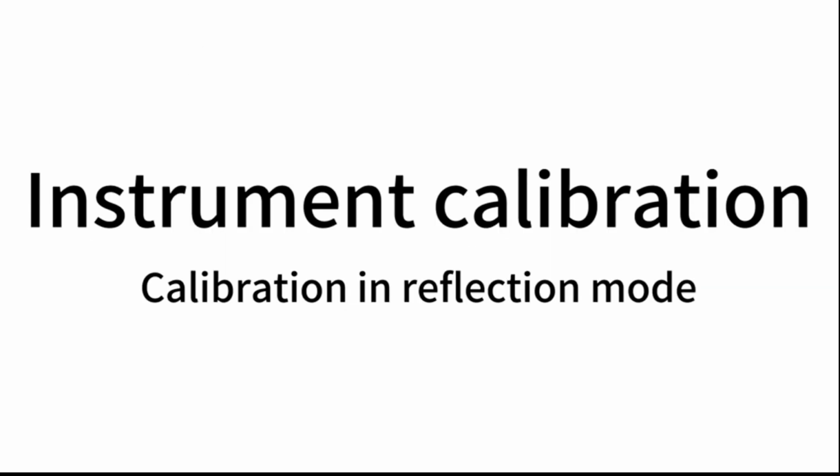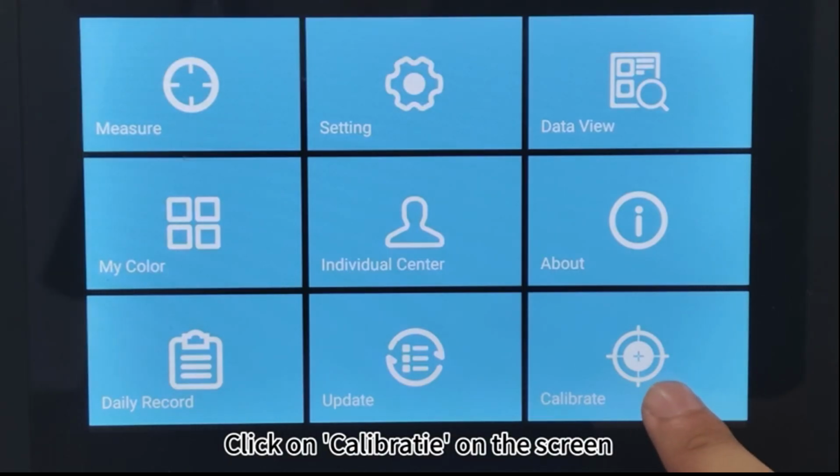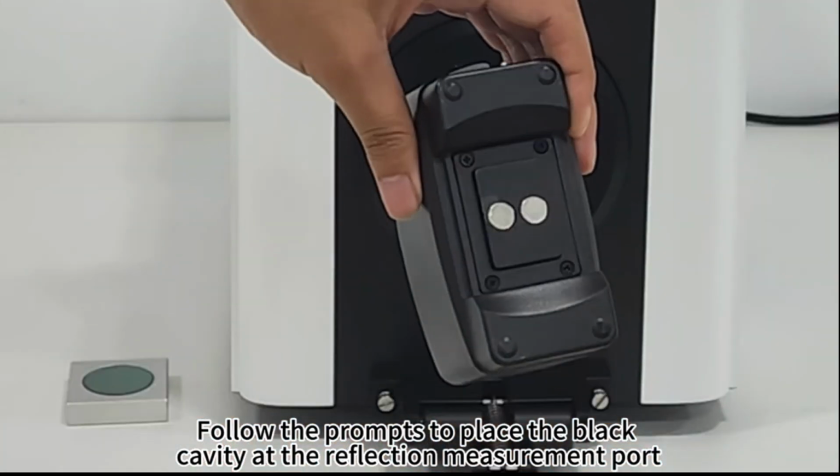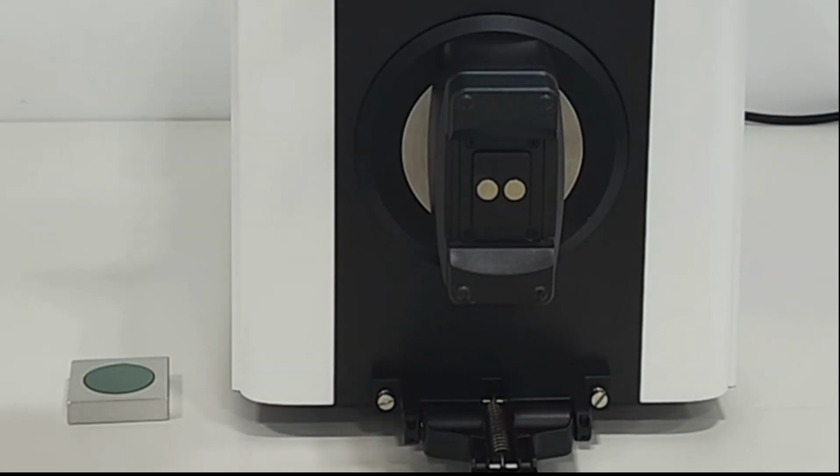Instrument calibration. Calibration in reflection mode. Click on Calibrate on the screen. Follow the prompts to place the black cavity at the reflection measurement port. Click on Calibrate.